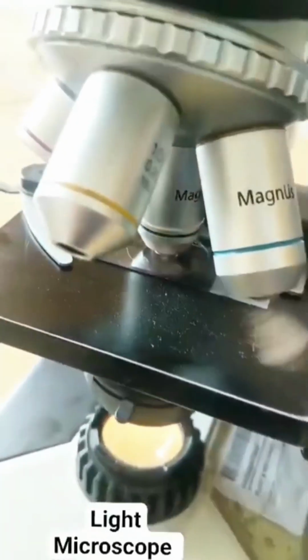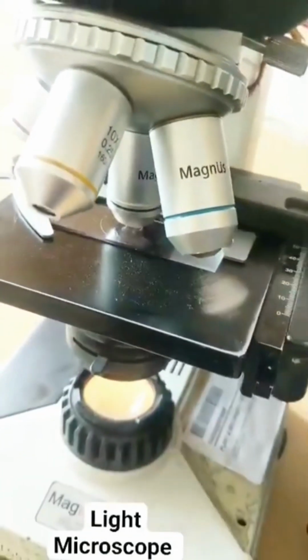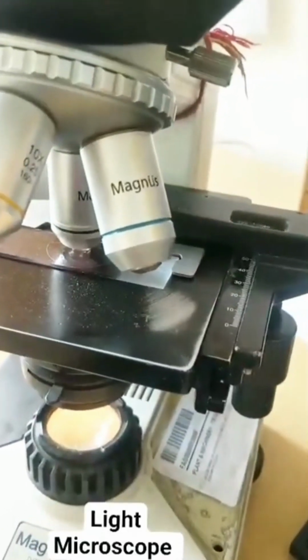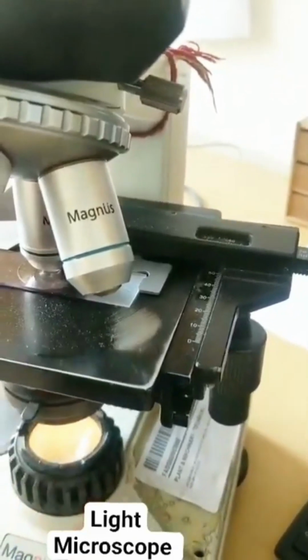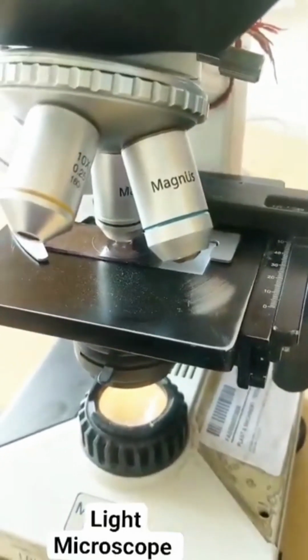So what is the big knob? When I move the big knob, look at this, the full stage moves, visible movement. So this is coarse adjustment. When I move the tiny knob, that is just fine adjustment. Further, you have a scale over here. In some cases, you might want to measure the distance of something that you see microscopically. So there's a scale present over here, known as the vernier scale, correct?